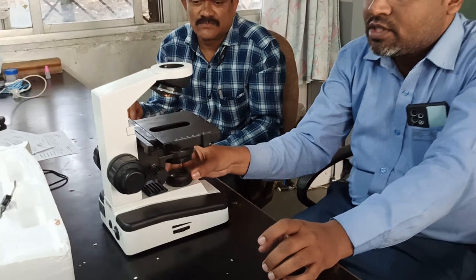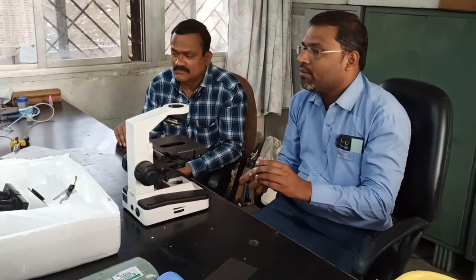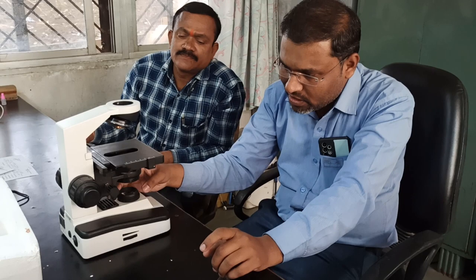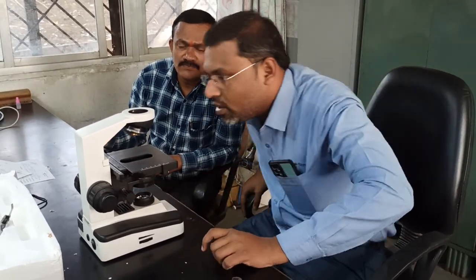So at the time of servicing, what we have to do is just open all these sections and clean them with the help of microfiber cloths. You have to use only microfiber cloths, otherwise you can use filter paper, otherwise there will be a chance of scratches on the screen, right? These two things are over.